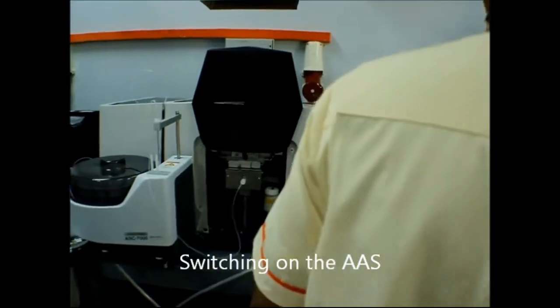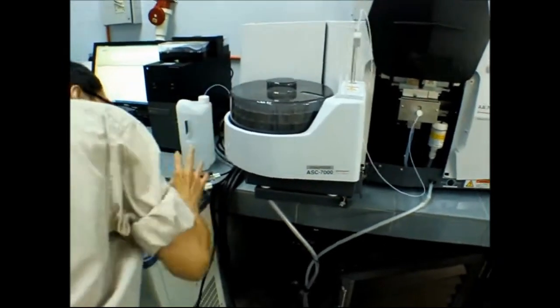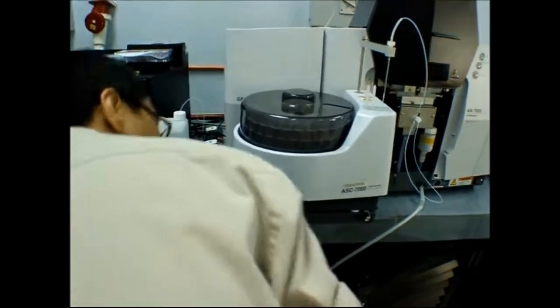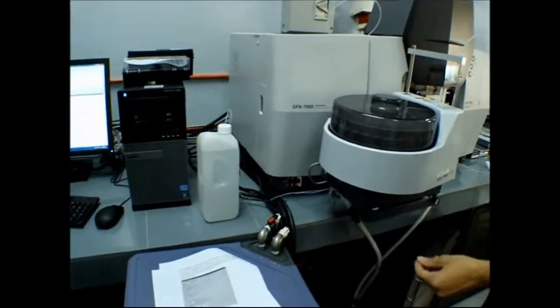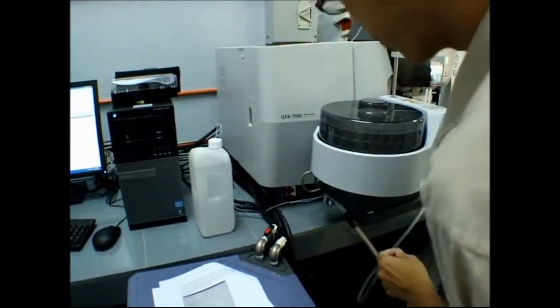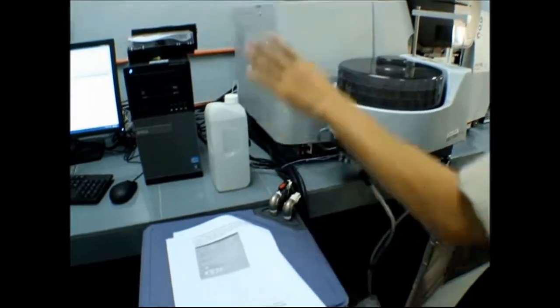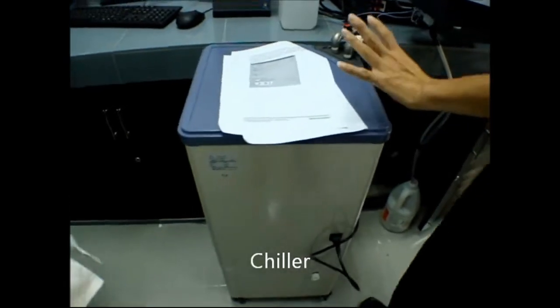Here. This is this one, don't. Oh, graphite. We use flame now. This is for flame. Then this is for chiller. Chiller is for the graphite furnace. So don't switch it on. We're using flame and not furnace, right?